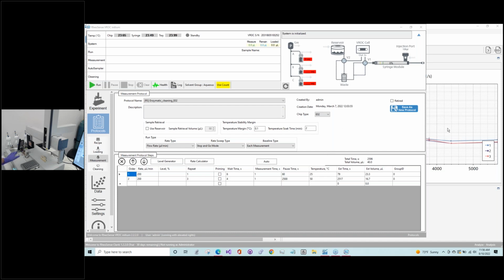The next question is about our solvent bottles, commenting on their size. These are 1,000 mL, or 1 liter. Yes, these are bigger than what the weight sensors will accommodate. We do this because if you have more solvent, you can go through more samples before you have to refill these bottles. So these are larger than what the weight sensors can handle, as Marina mentioned earlier.